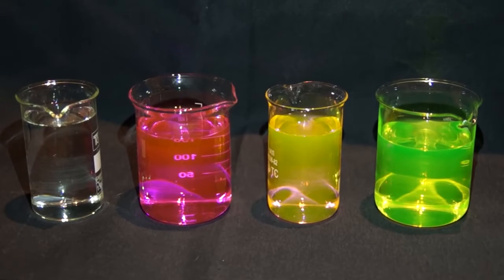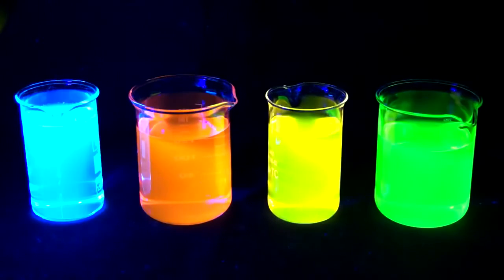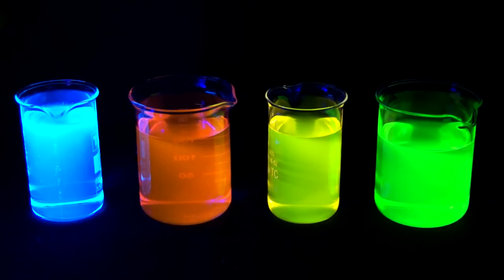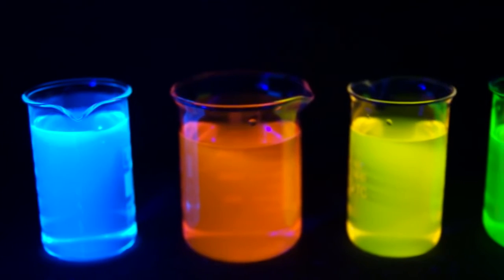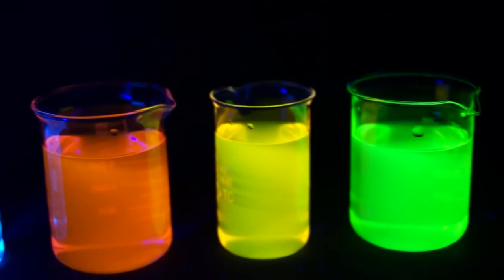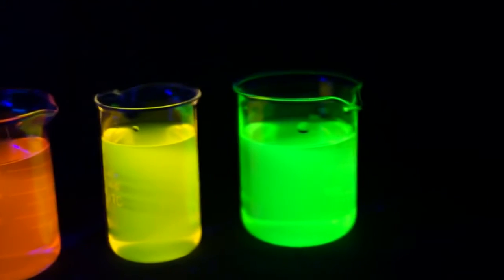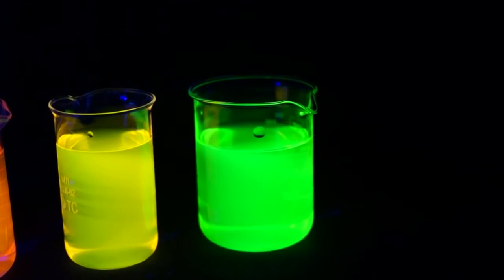At the moment, we are observing the solutions with fluorophores under normal light. However, let's turn on the ultraviolet light lamp. In the ultraviolet rays, the solutions look much more interesting, as it can be seen. Schweppes glows blue, Rhodamine B glows orange, Rhodamine 6G glows yellow, and the fluorescein solution glows bright green.